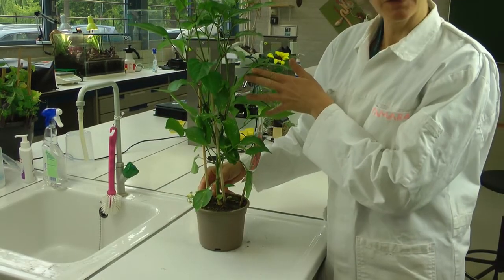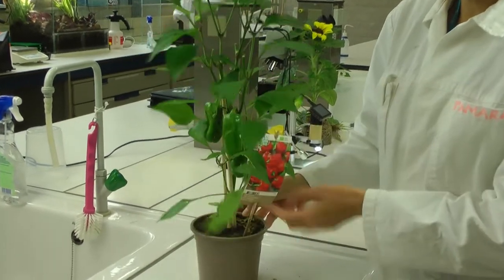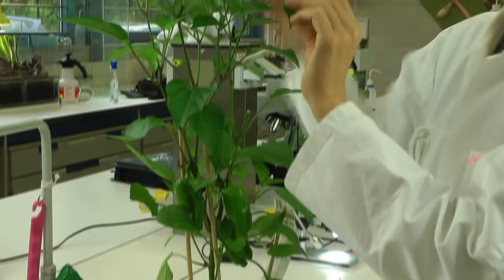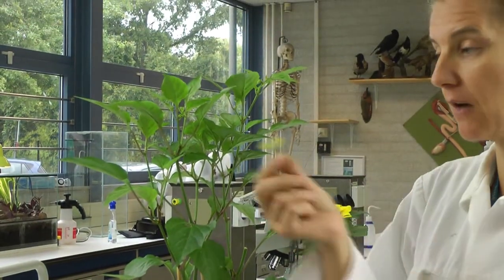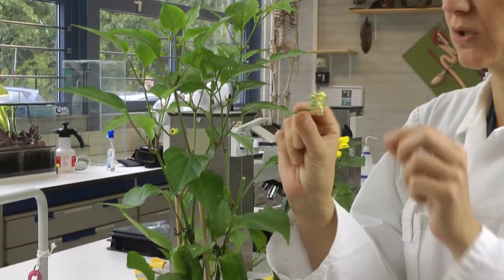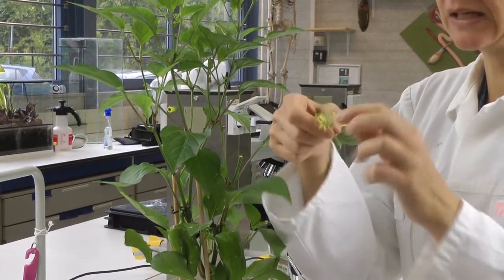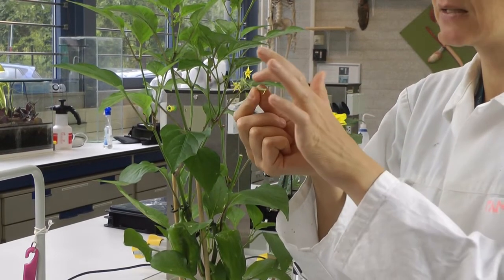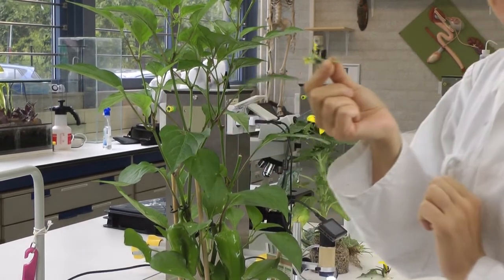Similarly, if you've chosen, for example, a plant from the solanaceous family, you may have fruits on it. This is a pepper plant. I was hoping it would have flowers. You can see the flower buds, but they haven't opened yet. But I have the flower of a tomato plant, which has a similar structure and form, where you can also clearly see the sepals, the petals, the anthers, and the stigma is inside the ring of anthers. We'll have a look under the microscope.